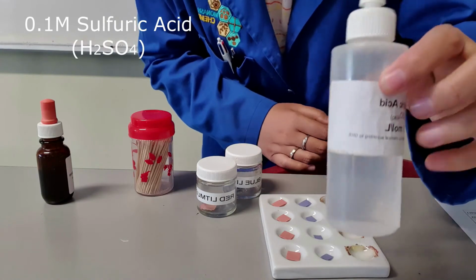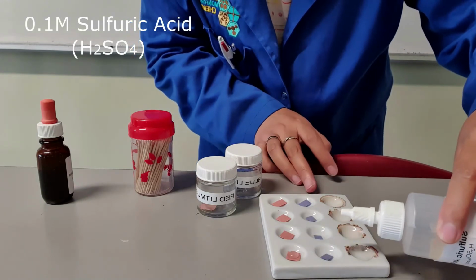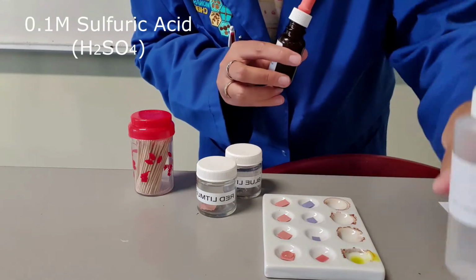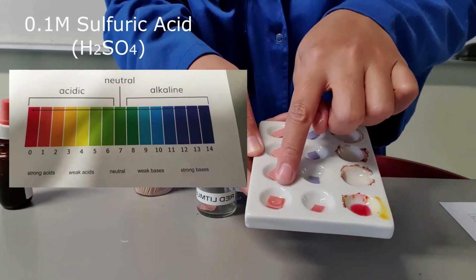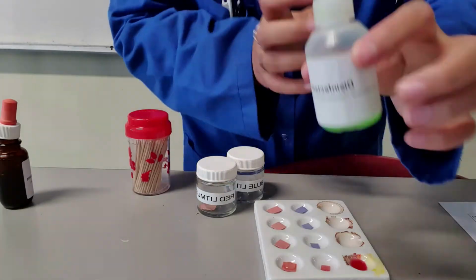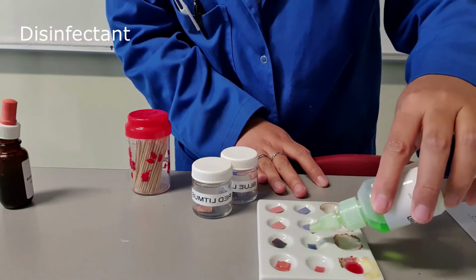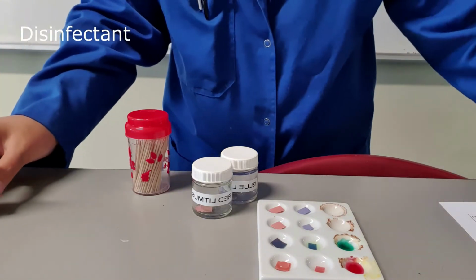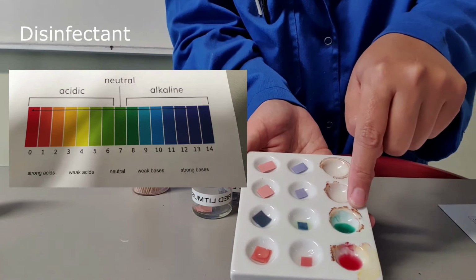Next is sulfuric acid. Red litmus paper, sulfuric acid, blue litmus paper in sulfuric acid, and universal indicator in sulfuric acid. The next one is disinfectant. So red litmus paper with disinfectant, blue litmus paper with disinfectant, and universal indicator with disinfectant.